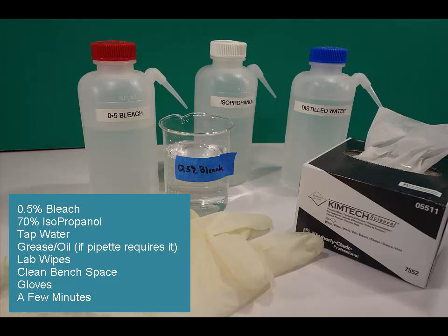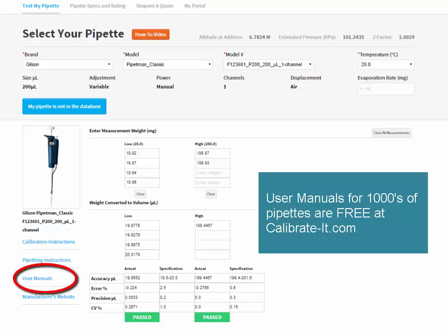A clean bench space, gloves, and a few minutes. It's a good idea to have the user manual to refer to as well. Let's get started.